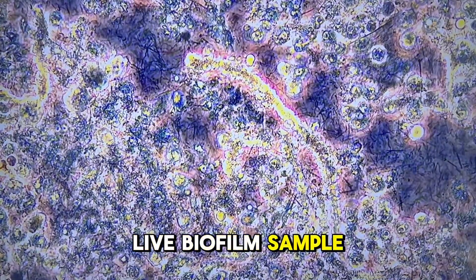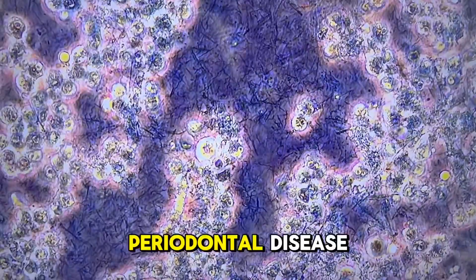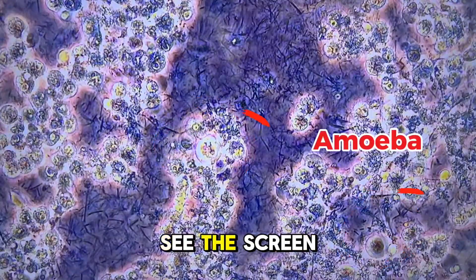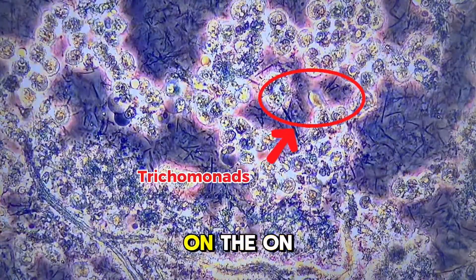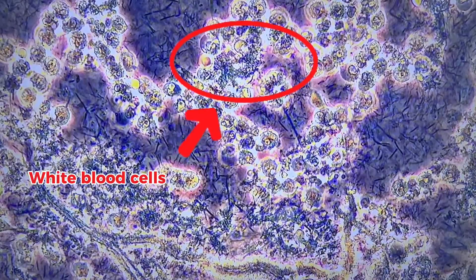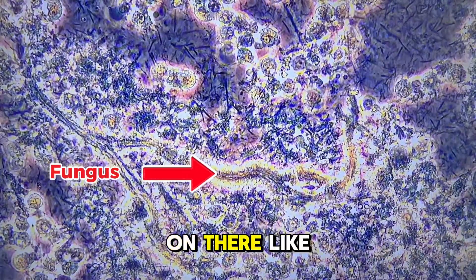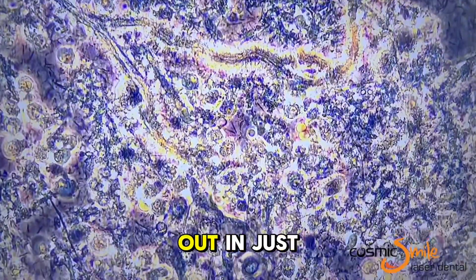This is a live biofilm sample from a patient with severe periodontal disease. As you can see, the screen is very full with lots of bacteria on the slide, a lot of white blood cells, and other parasites like amoeba and trichomonas which I'll point out in just a sec.